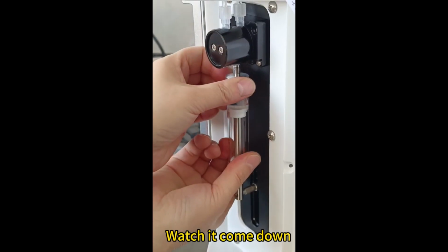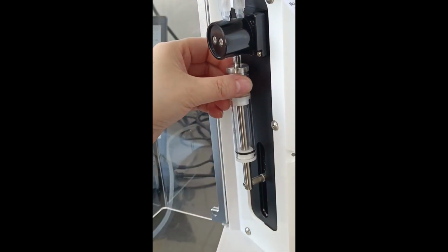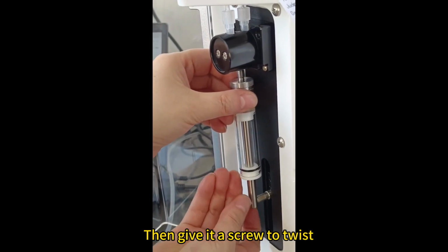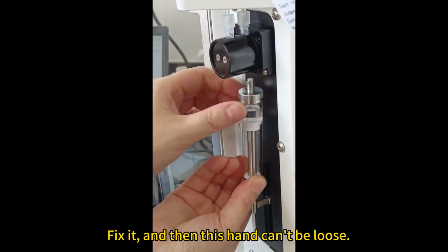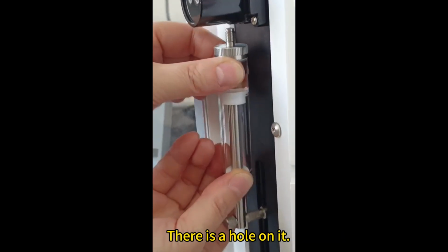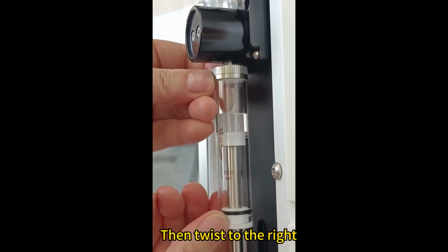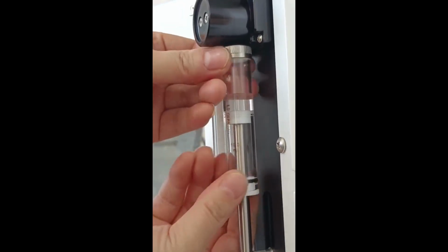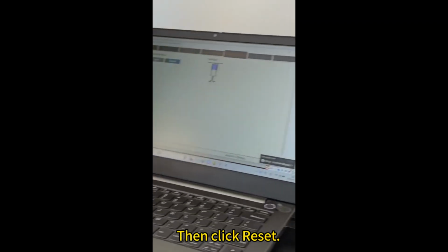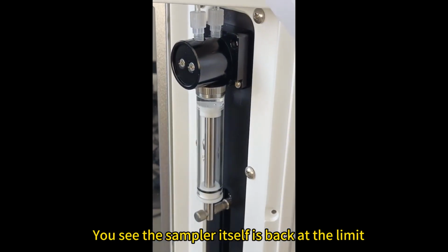After unscrewing, watch it come down. How to install it? Same here. Put it on first. Then give it a screw to twist. Screw to the right. Fix it, and this hand can't be loose. Then we go to the top. There is a hole on it. Fit this onto this hole until the top of the head doesn't move. Then twist to the right. Tighten. Then it's okay. Then click Reset. You see the sampler itself is back at the limit.